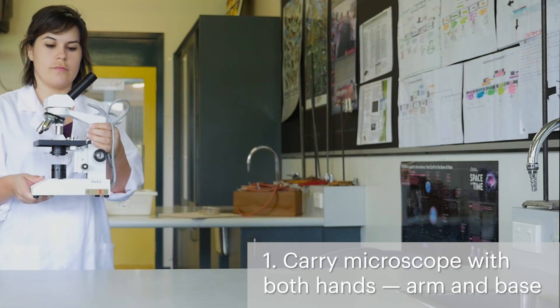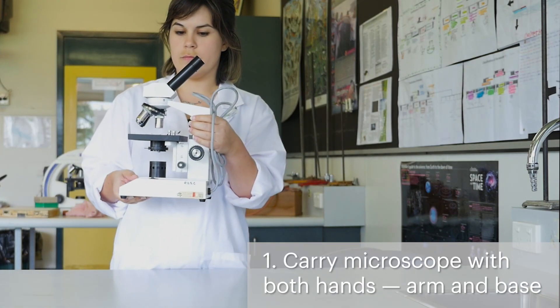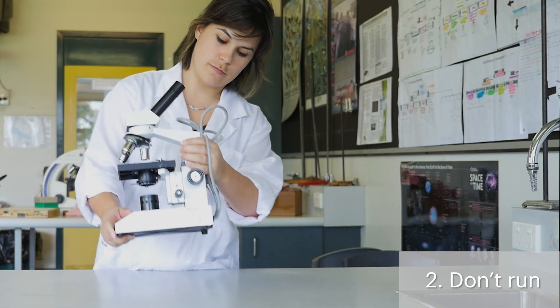Always carry the microscope with both hands, one holding the arm and one under the base. Walk, don't run when carrying the microscope.